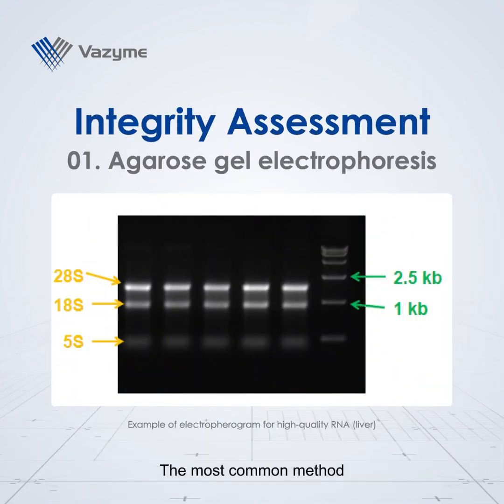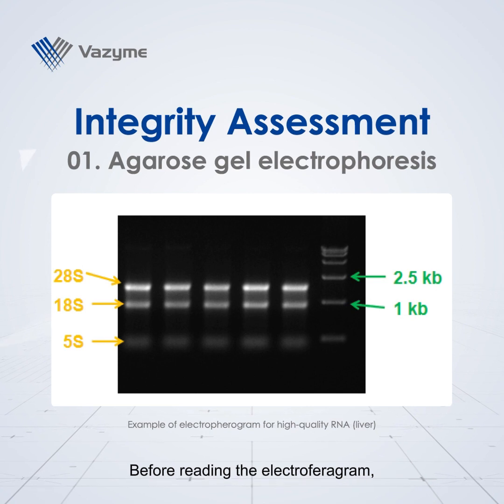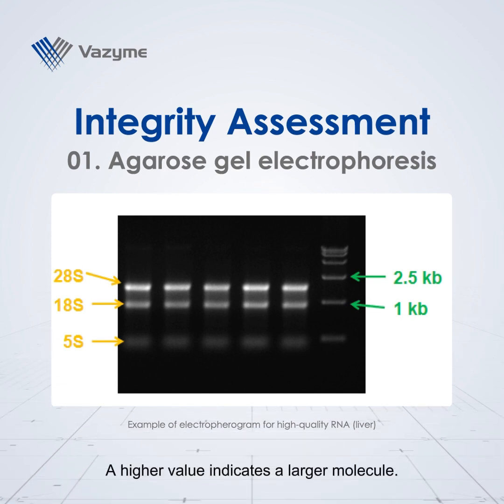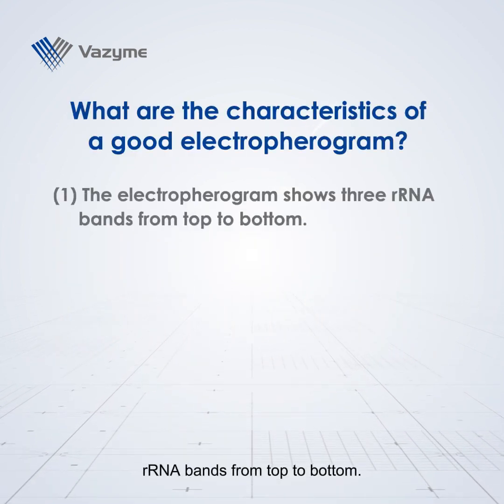The most common method used to assess the integrity of total RNA is to run RNA on an agarose gel. Before reading the electropherogram, you need to understand the term sedimentation coefficient, which is a measure of the rate at which a biomacromolecule sediments in a centrifugal field. A higher value indicates a larger molecule. The electropherogram shows 3 RNA bands from top to bottom.